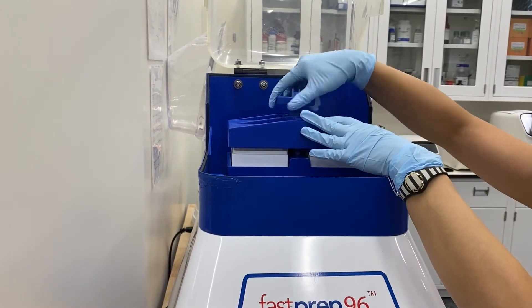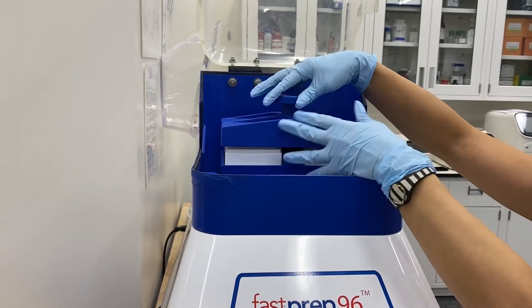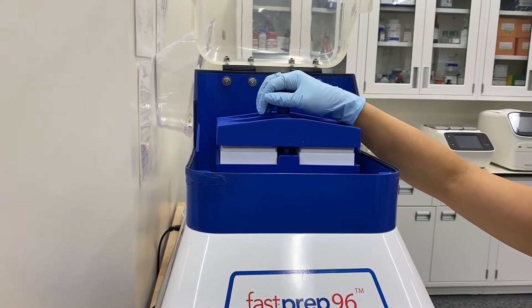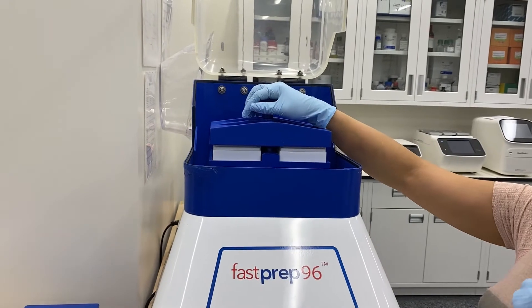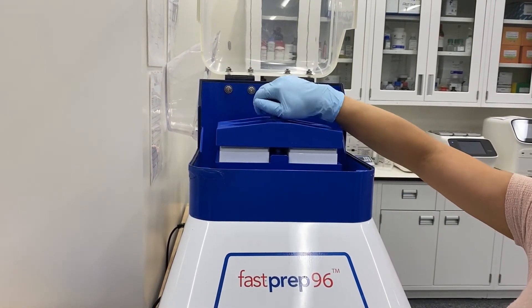It's important that this is really secure. A lot of mistakes customers will make is not having it sealed, and many times you may experience your tubes breaking, busting, leaking, or sometimes the caps just aren't all the way sealed.